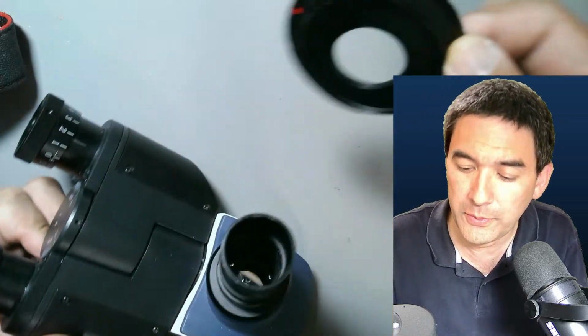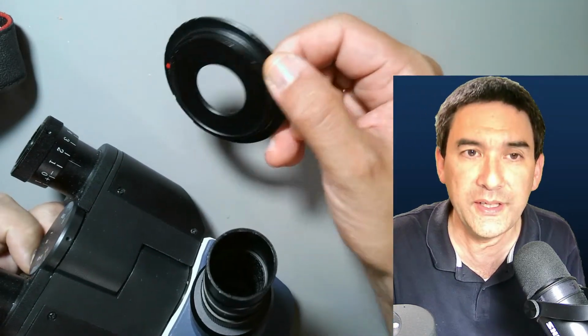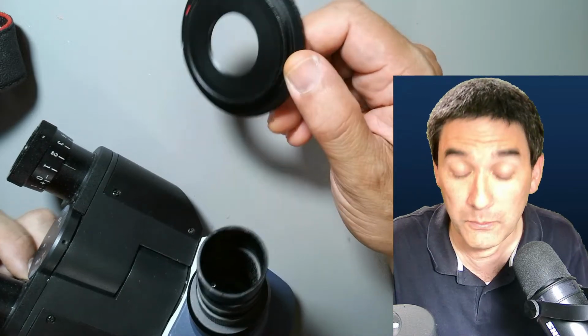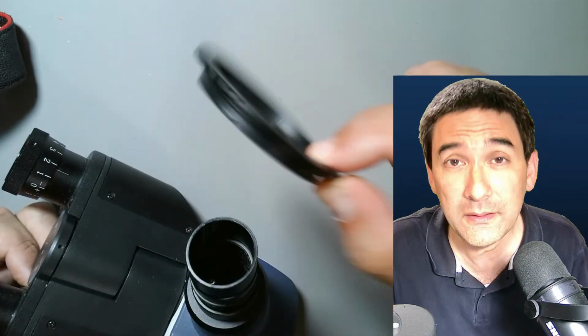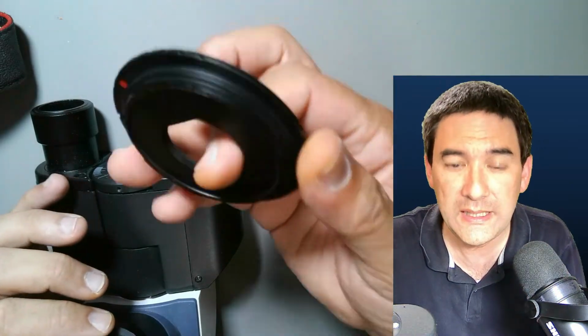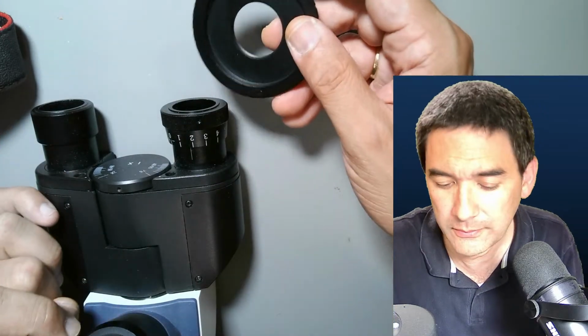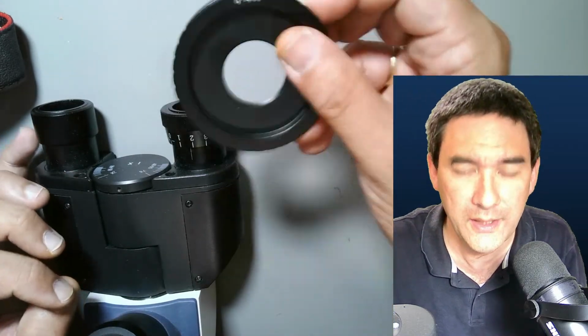So this is something I just wanted to share with you, because I actually didn't know that it existed, and I just recently discovered it. I tried it out, and it actually works. Depending on the objective that you use, there might be a little bit of vignetting. This basically means some of the corners might be a little bit darker. But the field of view that you're getting is quite large, and that's also quite nice. So before trying other things, I would try this here.